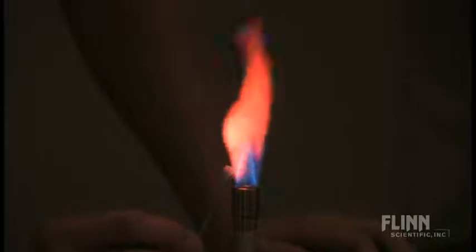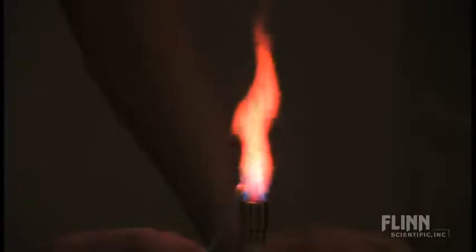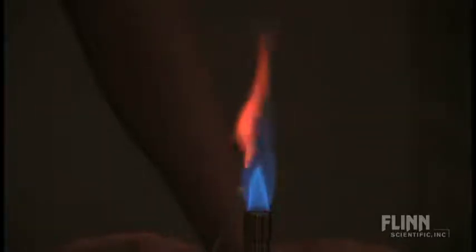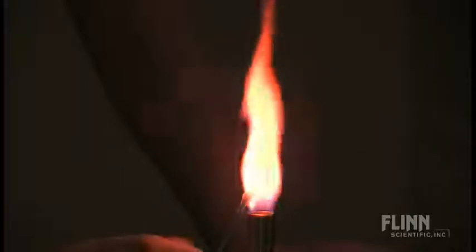And then I just hold this in and the students can see a very brilliant gold flame from the sodium when it touches the edge of the flame. And I also told them to hold this on just the very edge of the burner because inevitably some of the salt drops in. And it's better to hold it on the side. So you get a very brilliant gold flame for sodium.